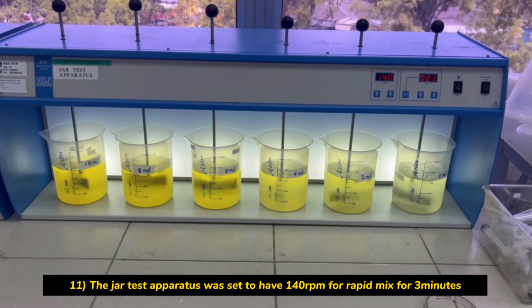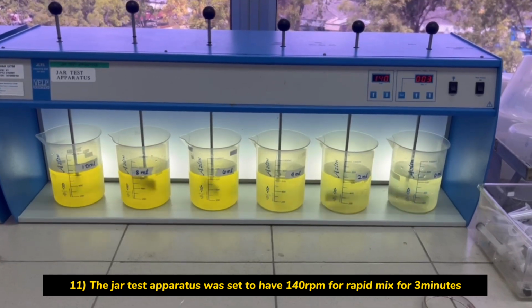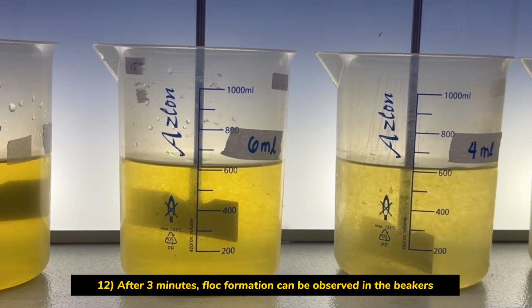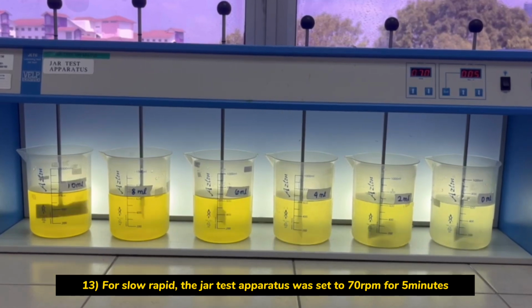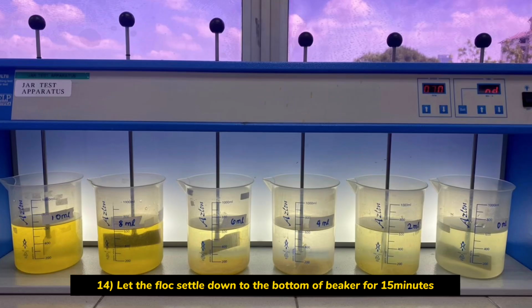The jar test apparatus was set to 140 RPM for rapid mix and a 3-minute timer. After 3 minutes, floc formation can be observed in the beakers. The jar test apparatus was then set to 70 RPM for slow mix and a 5-minute timer. And then let the floc settle down for 15 minutes.